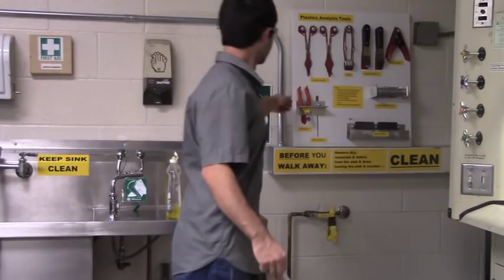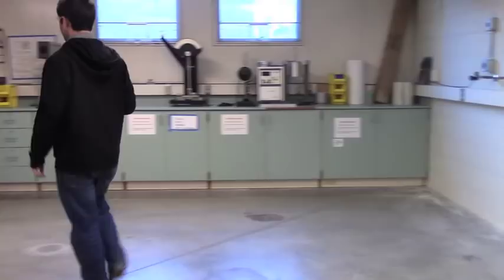If your workpiece is too large, you may need to get a pair of clippers from behind the fume hood. This way you can trim down your sample so it will easily fit on the anvil of the Rockwell Hardness Tester.